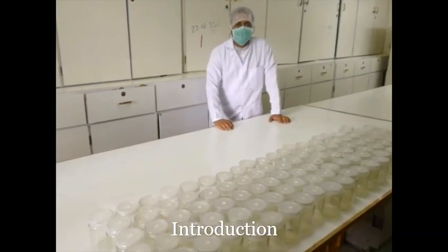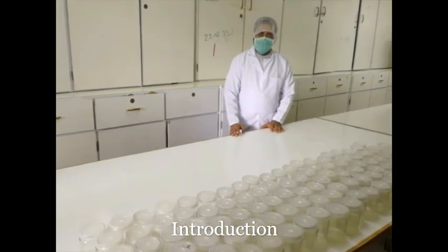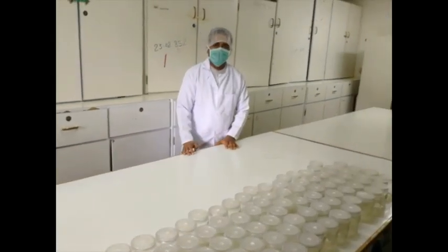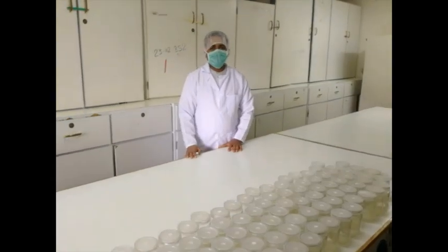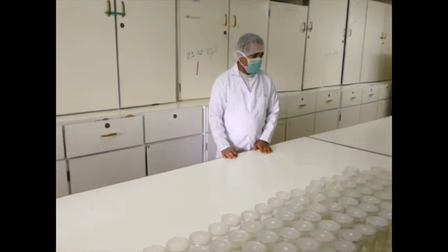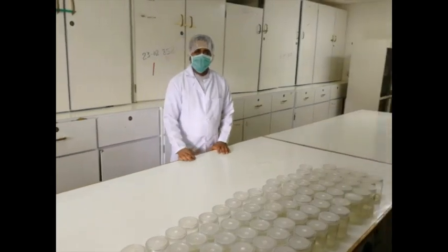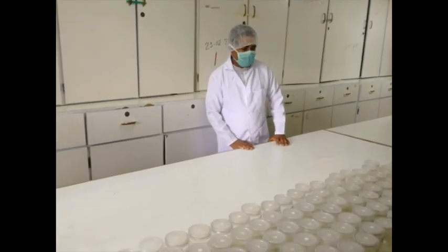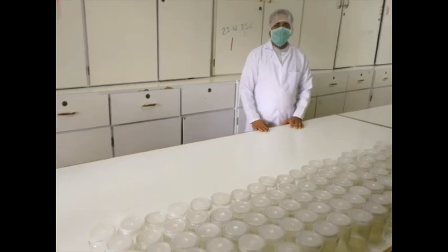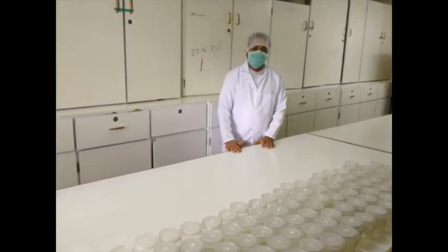I am a researcher at Jimma Agricultural Research Center, and currently I'm the coordinator of the Plant Biotechnology Department. To begin with the lab organization, like any other tissue culture lab, we have a washing room, media preparation room, culture media and equipment sterilization room, and also an aseptic transfer room and a plant growth chamber or growth room.